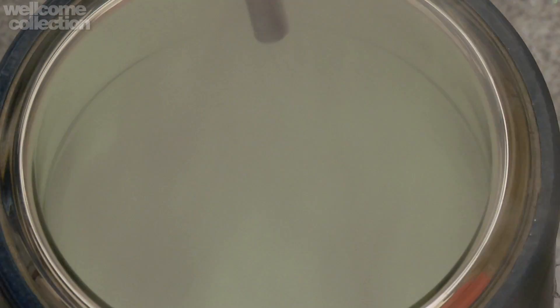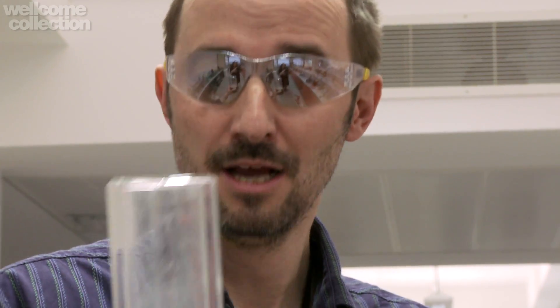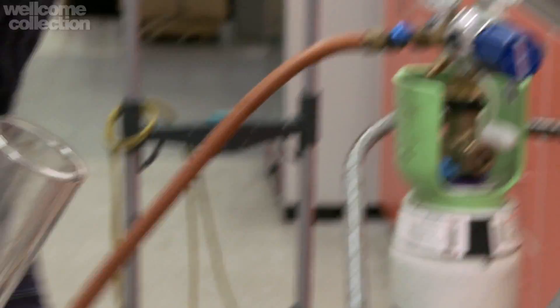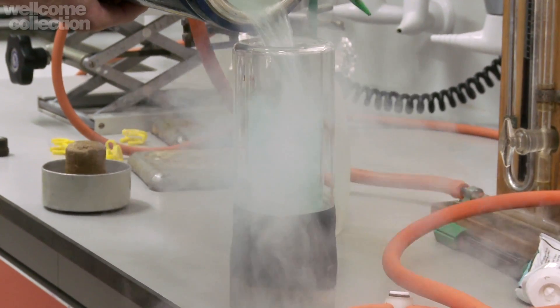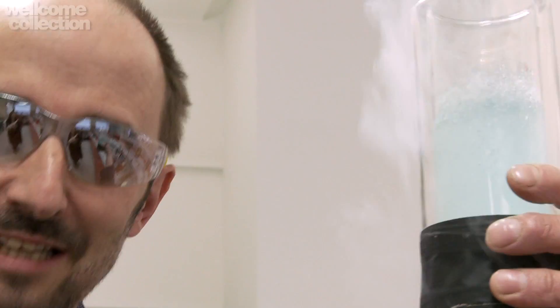And it's very important because oxygen is really quite unique in that it's not colorless. So I think we've collected enough oxygen, and now we should actually go and take a look at it. What we'll do is pour it into this beautiful clear thermos so that we can see the color more clearly. I'm going to turn off the flow of the oxygen, pull the coil out — and you can see a little bit of a squirt there of the liquid oxygen coming out. And now I'm going to pour it into this Dewar flask. And what you see is this splendid pale blue boiling liquid. That's liquid oxygen.